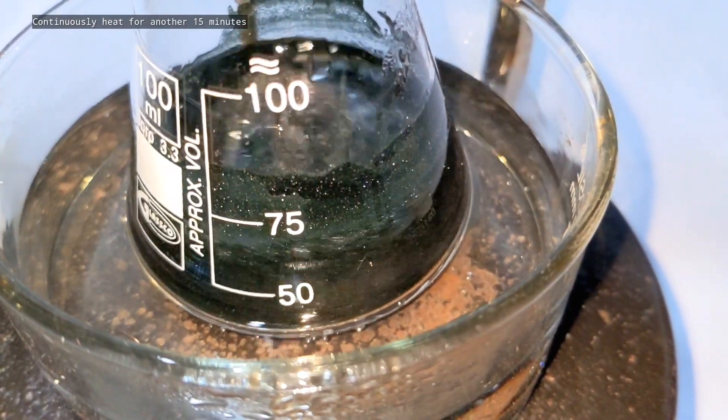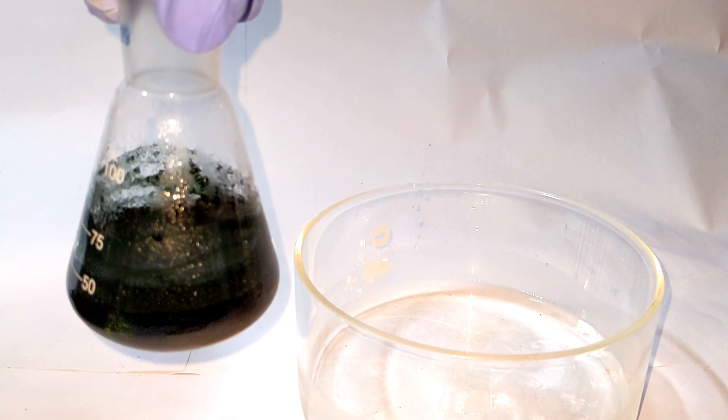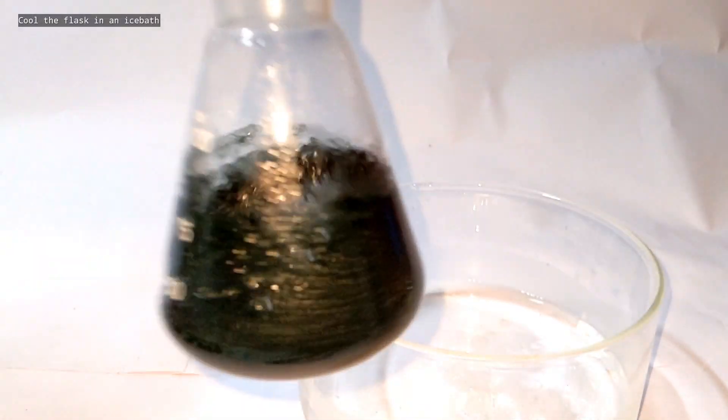After the addition of hydrogen peroxide, the solution was heated for another 15 minutes. Then we take it out and allow to cool to room temperature.